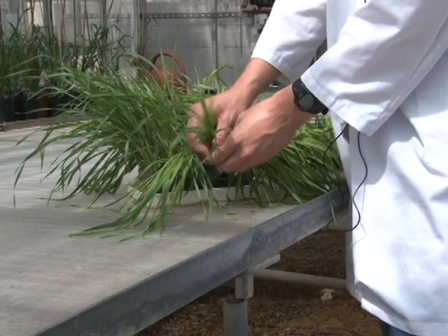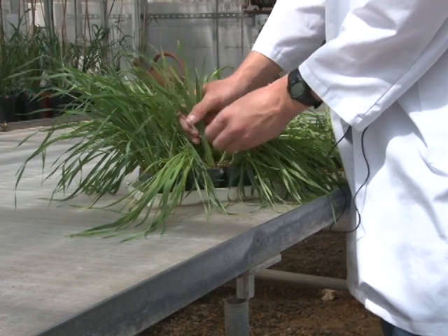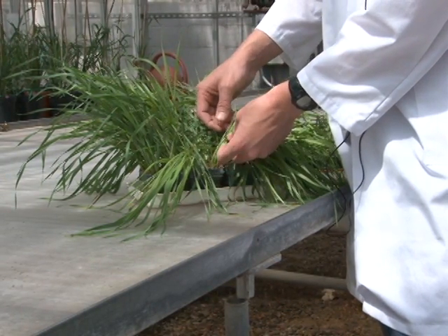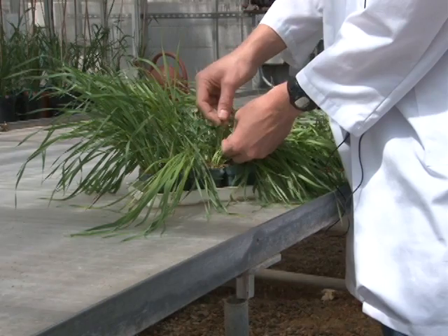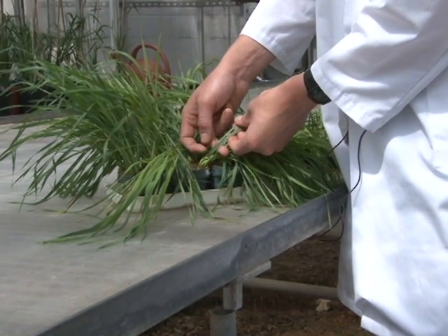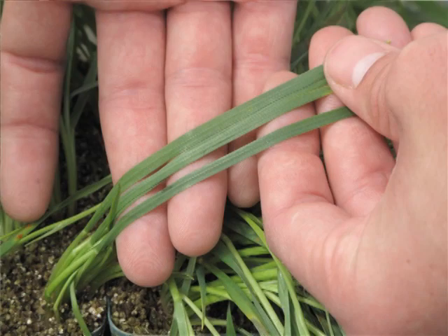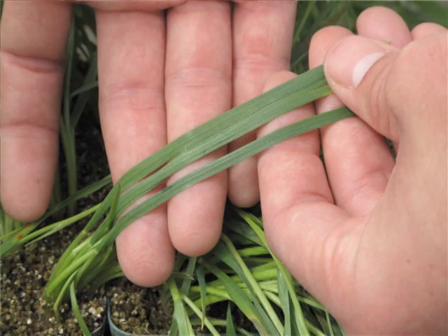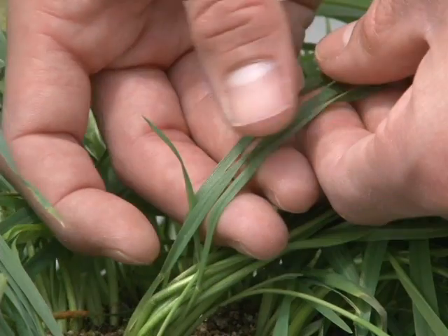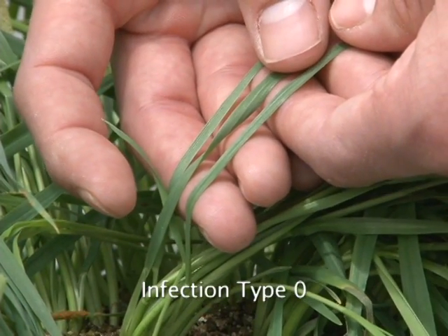As an example of a zero infection type, I would like to show this monogenic line with SR36. When you look at the primary leaves that have been inoculated with the isolate of rust, you can see no visible symptoms of rust. So this is what we classify as a zero infection type.